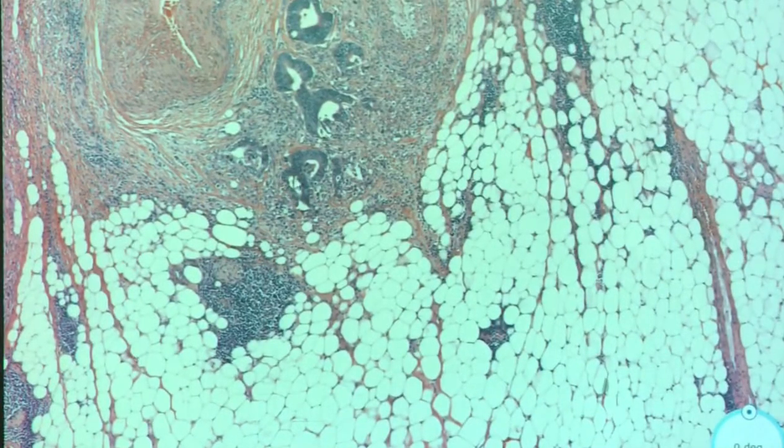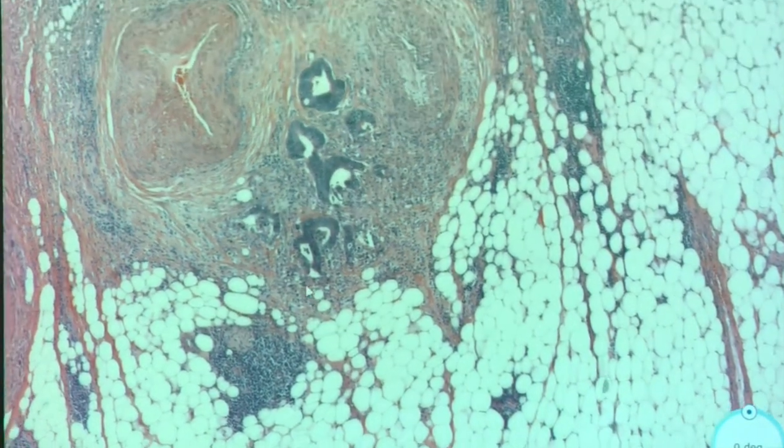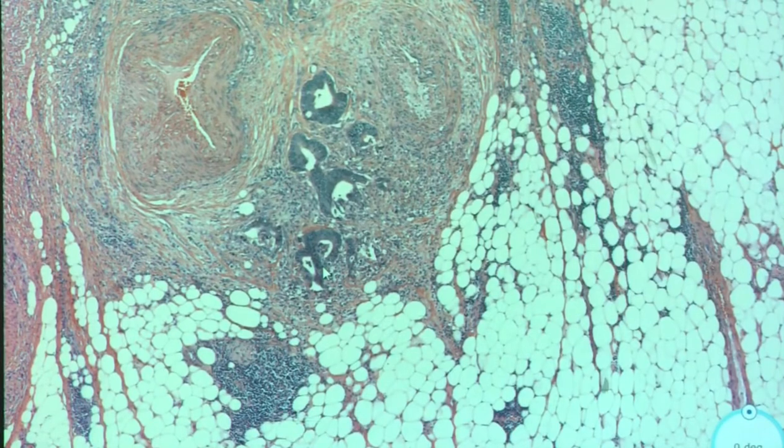So this is sometimes stage 2? So it's in the fat, so that would be stage 3. Where is it in the fat? Is this considered fat? Maybe. So if it's in the fat, then that's stage 3. Okay, staging is in your handout. It goes backwards, from the lamina propria outward. It's like 2A if it's into it but not halfway through, and then 2B, and I always look it up.